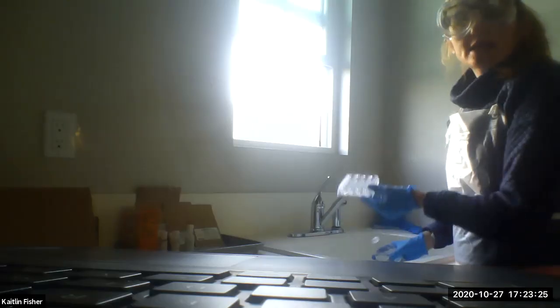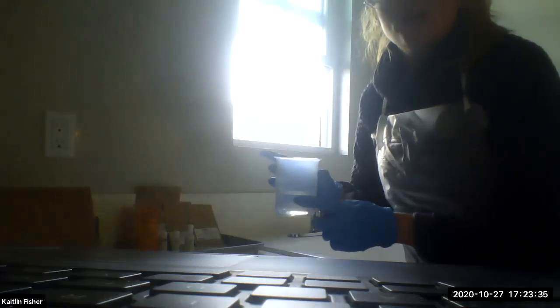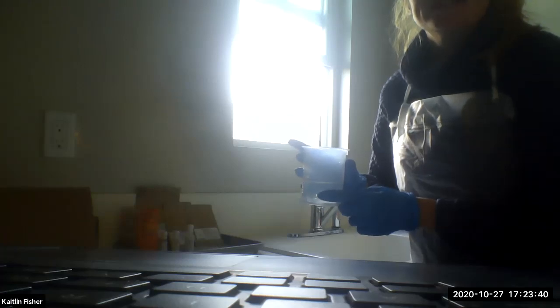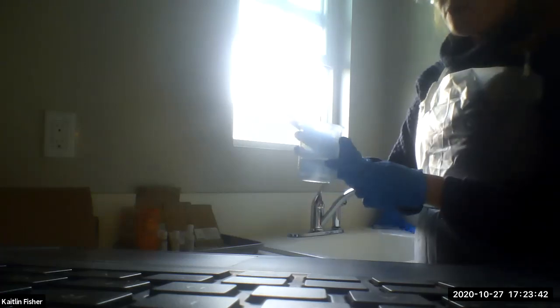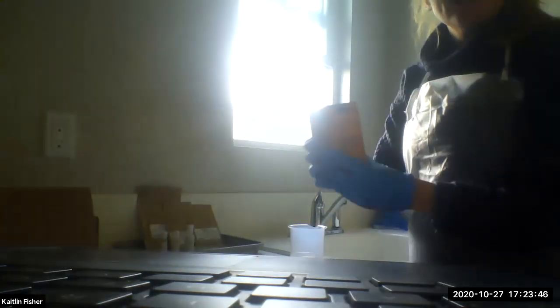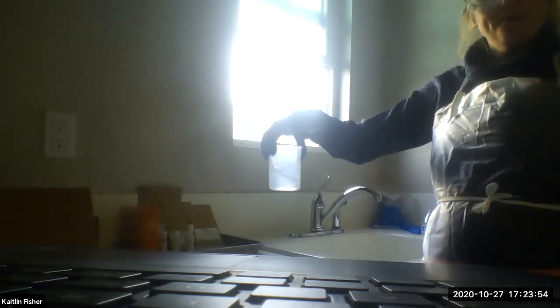So once the well plate has all the chemicals removed, then you can rinse it off normally like you would wash dishes. But now, once you have this waste container, and by the way, this will probably be a pink color from some of your tests with the iron chloride, what I would do is add a little bit of baking soda to it, just to neutralize any acid that's left. Give it a good swirl.